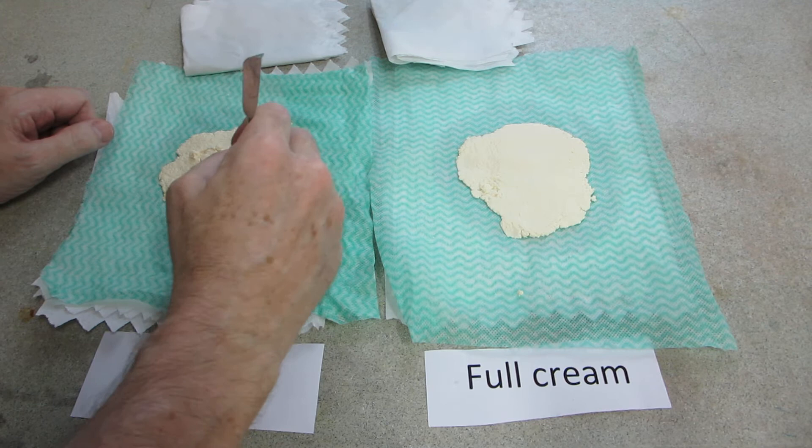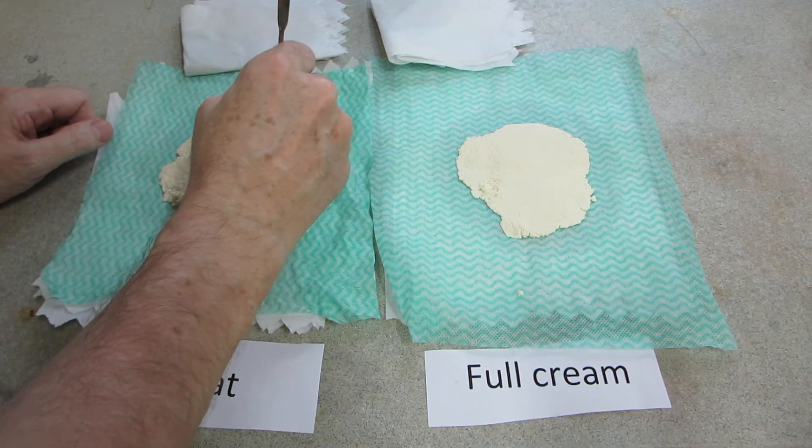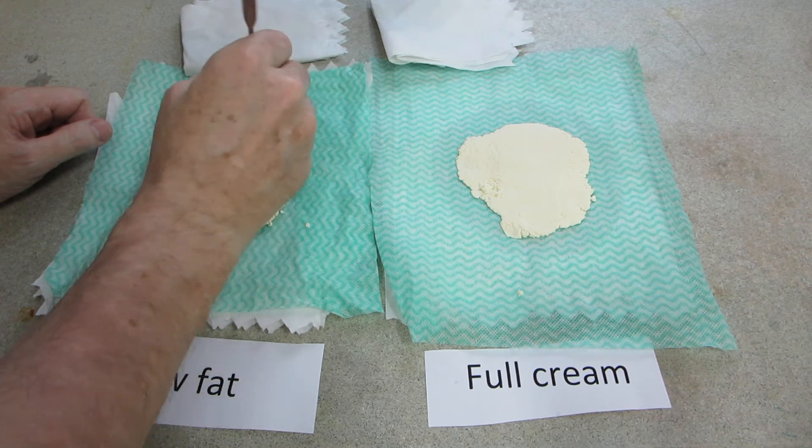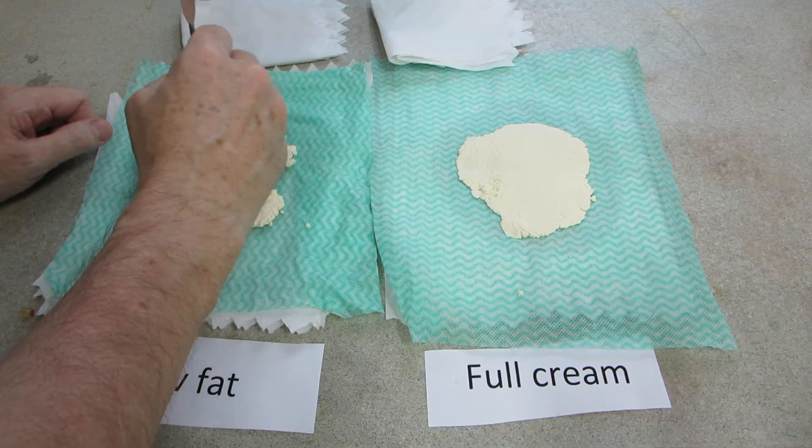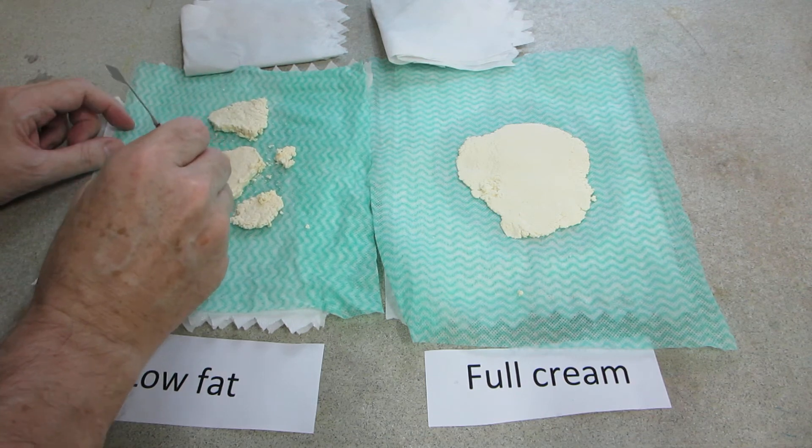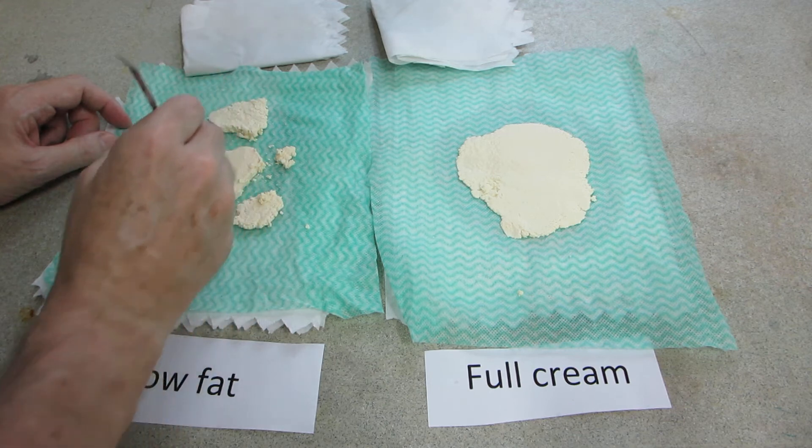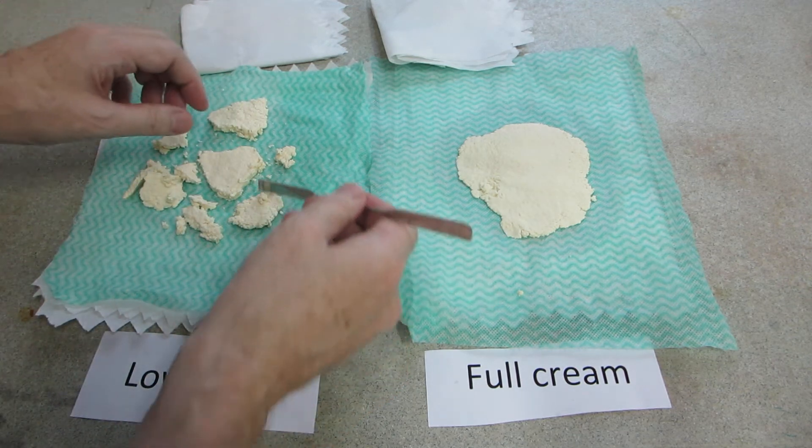There, low-fat, good for the heart. Not much of a crumbly heart there really.